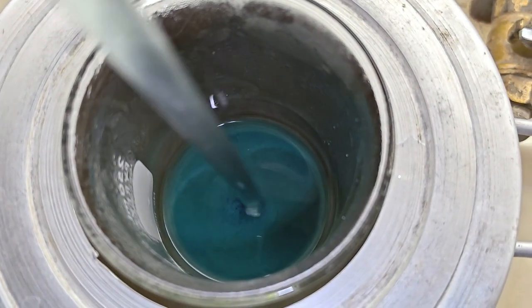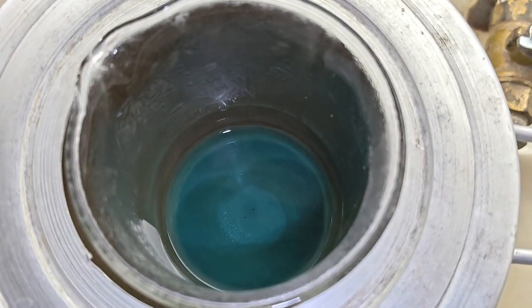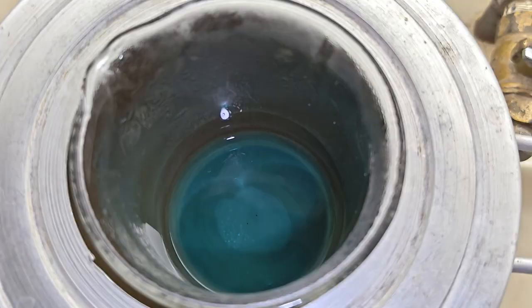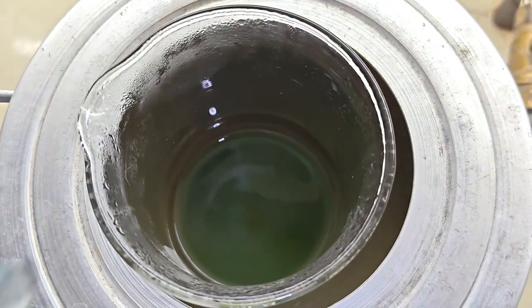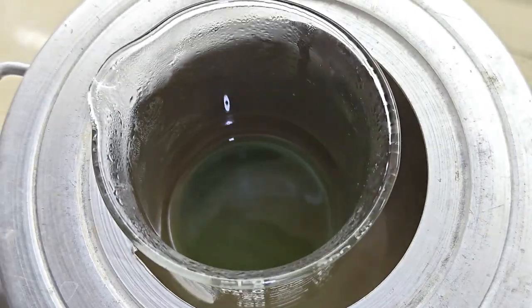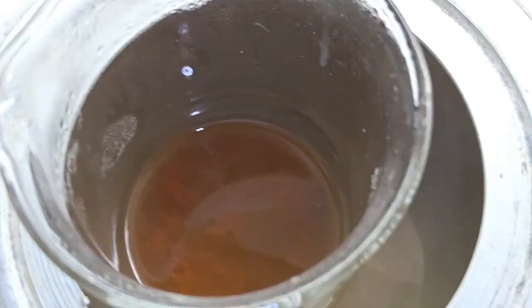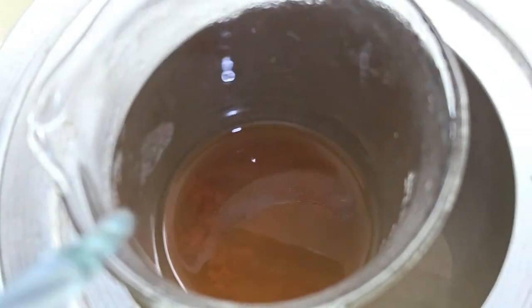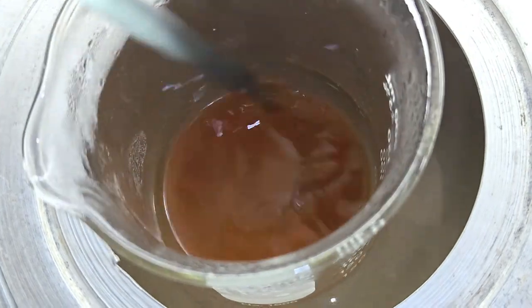Overall, the experiment showed that diffusion depends on both concentration gradients and membrane properties. Molecules naturally move from areas of higher concentration to lower concentration, but whether they can cross depends on their size and the permeability of the membrane. The cling film membrane allowed iodine diffusion but restricted glucose movement, demonstrating how membrane structure can greatly influence transport outcomes.